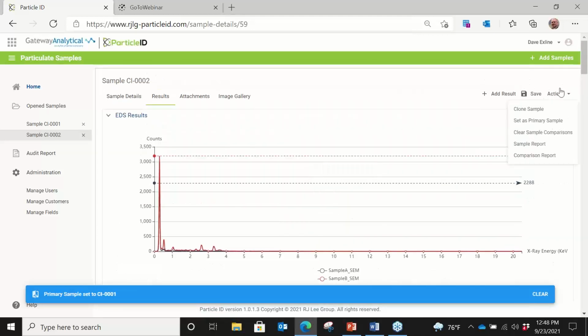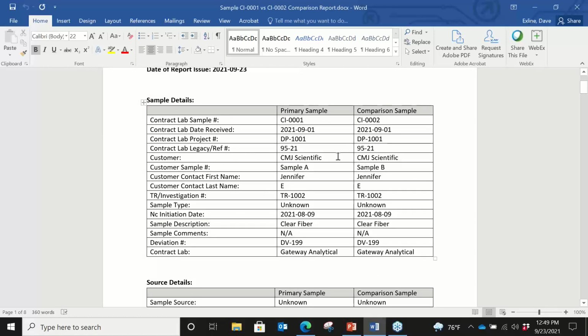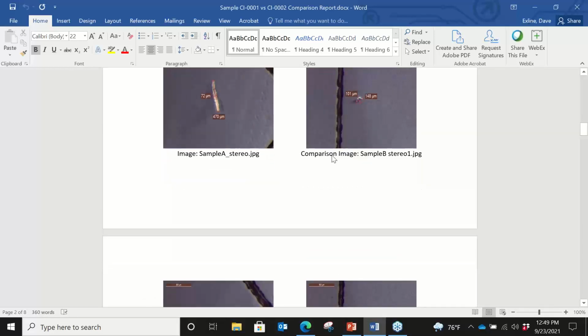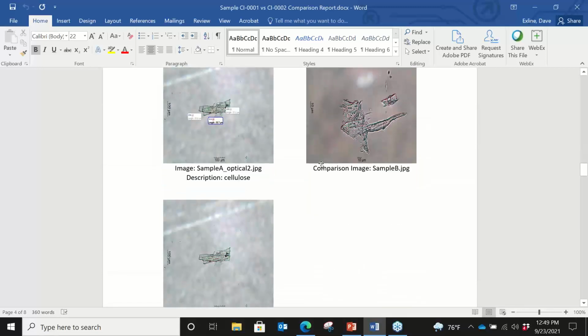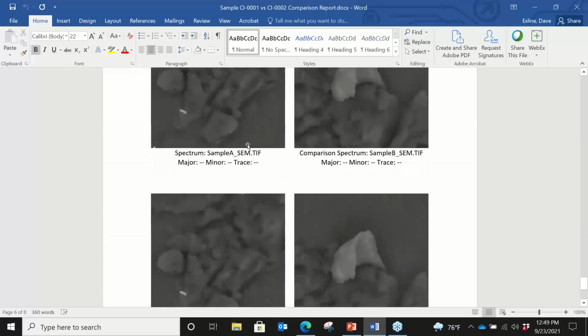From an action standpoint, then we can also create a report for that, or we can create a comparison report. So for these two examples, we've created a comparison report, and this automatically just generates. It gives the customer sample number, customer name, and all of the information that you have within the comparison. So then this can be taken and put in with the project folder or be cut and pasted. This is a Word document, so you can save it as a PDF, or you can cut and paste it into another function as you're going through.